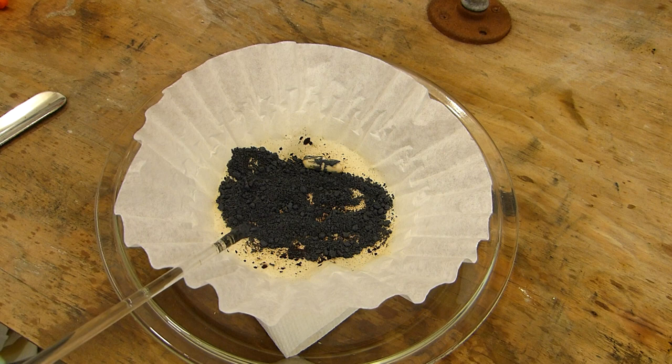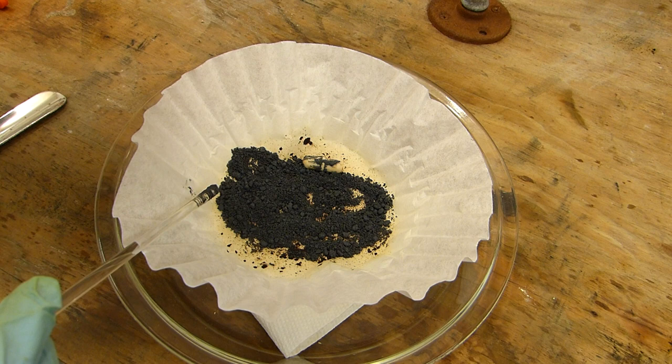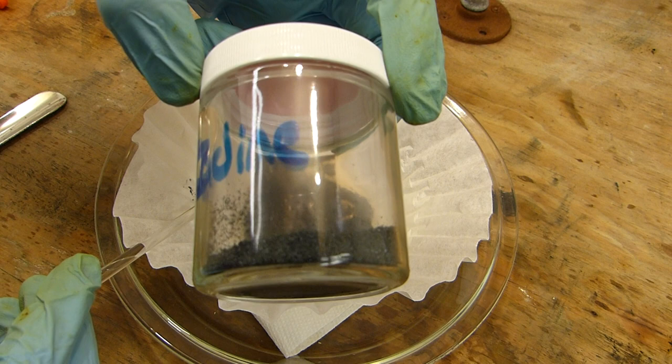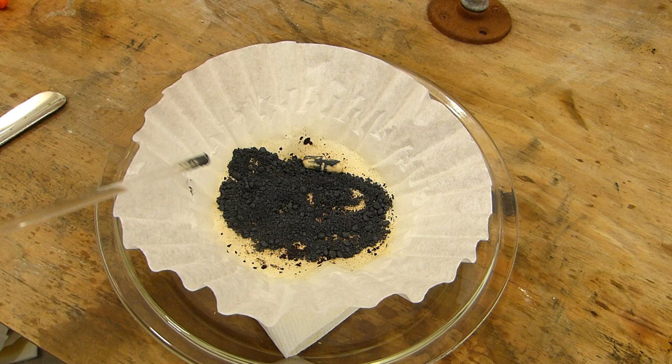But that's sort of a subject for a future video. So I think for now this is good to go and store in the storage container. And I just have a small jar here. I just throw my iodine in.